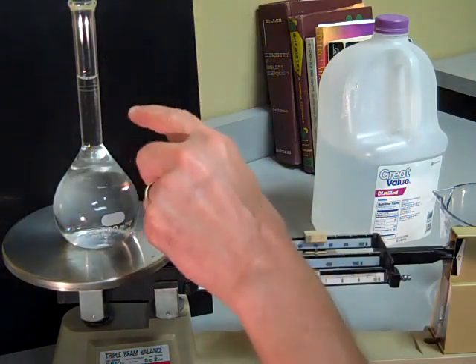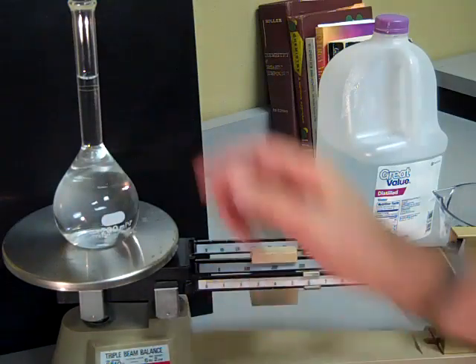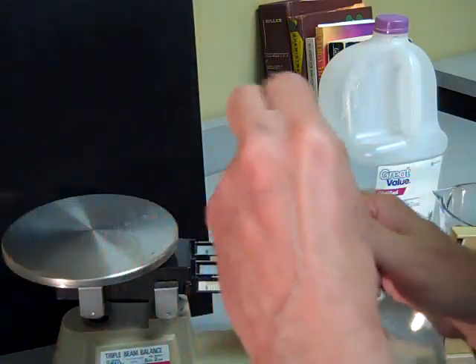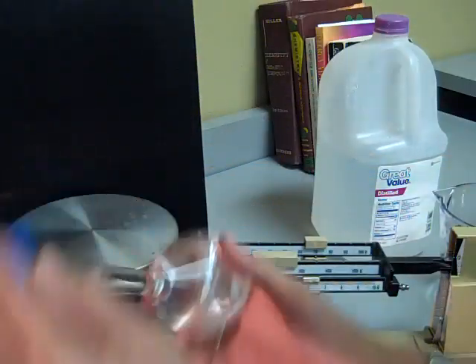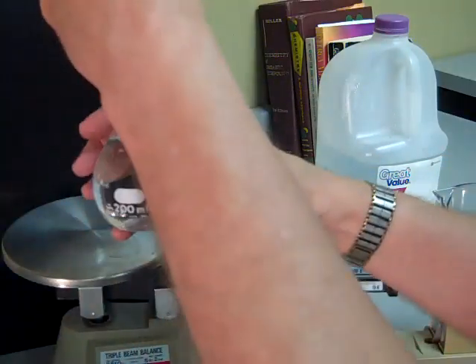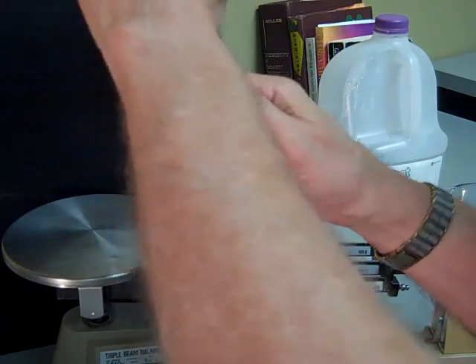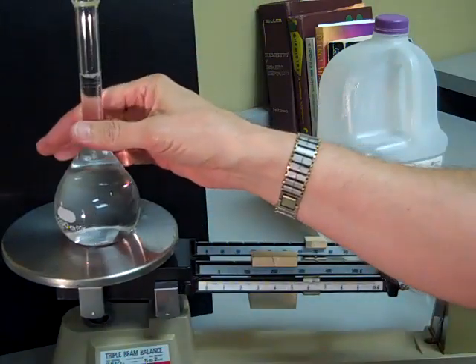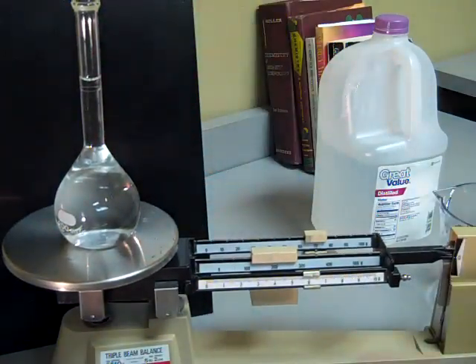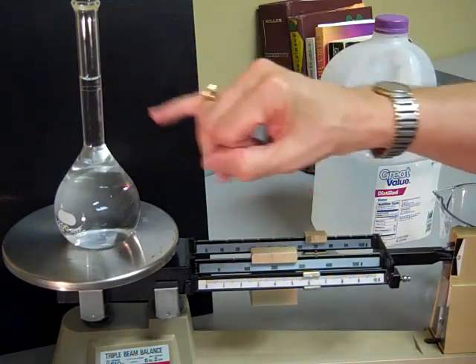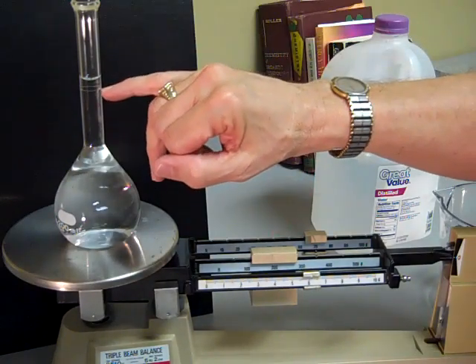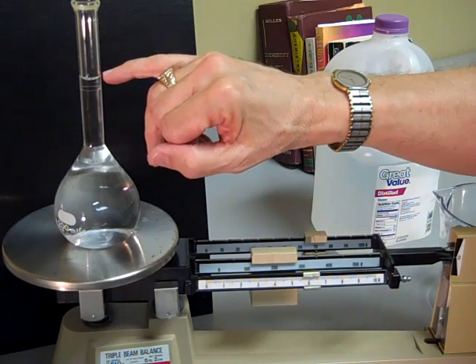That is the amount of expansion of the solution. I'm going to cap this and just mix it once or twice. There we go. And then just set it here.